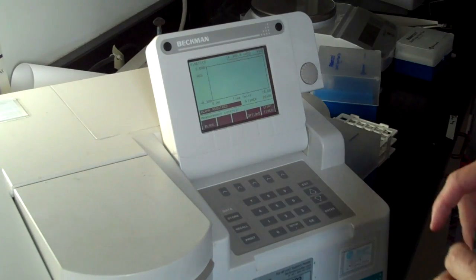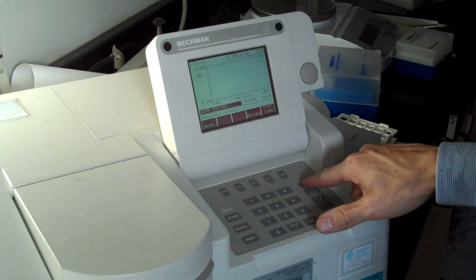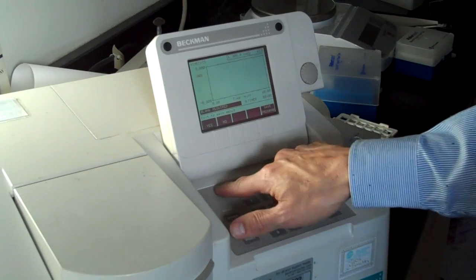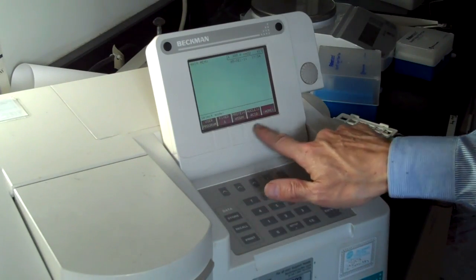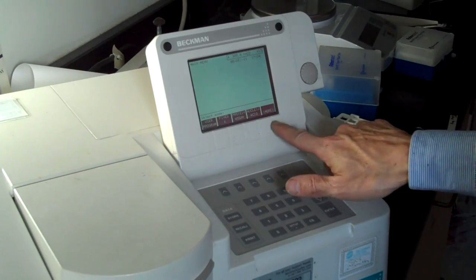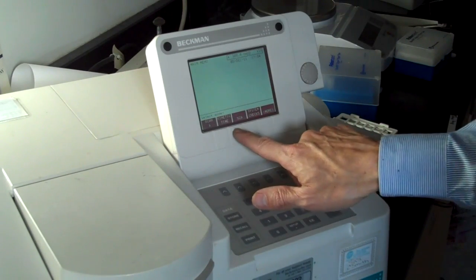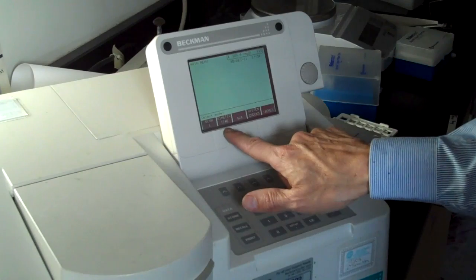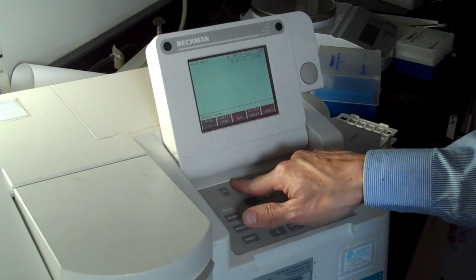This video is going to show you how to use the Beckman to do a kinetic scan, meaning you're measuring a reaction rate. I'm going to go to the main menu. Exit to main menu? Yes. Here I've got things that you have used before, like the fixed wavelength and the scan lambda, meaning a wavelength scan. The one you want to use this time is the kinetic time. So it says kinetic time. I'm going to click that button.